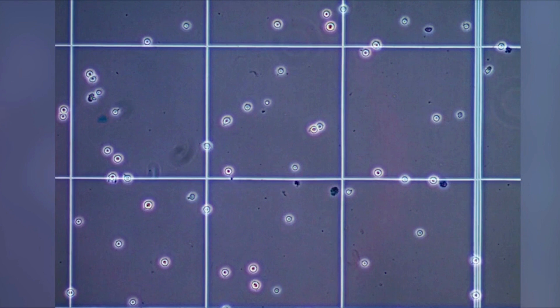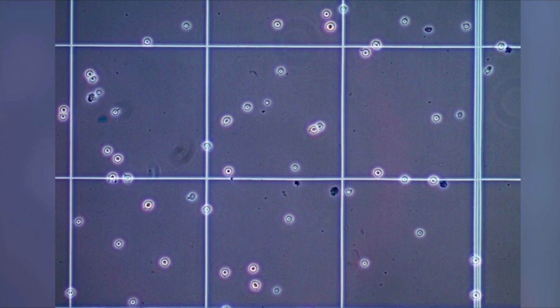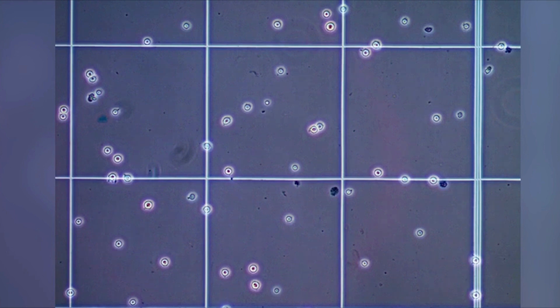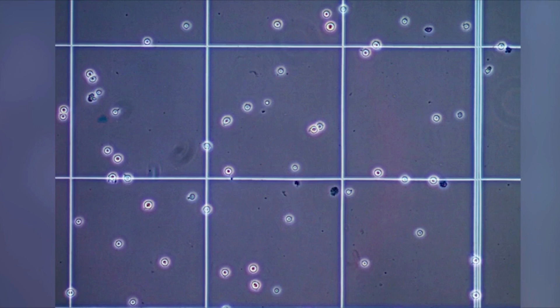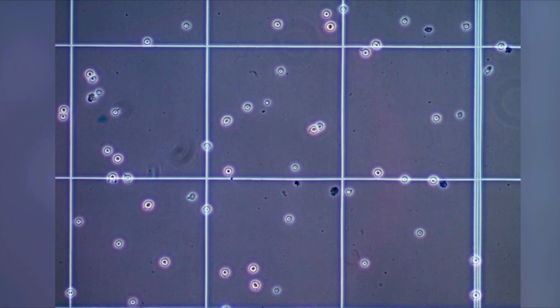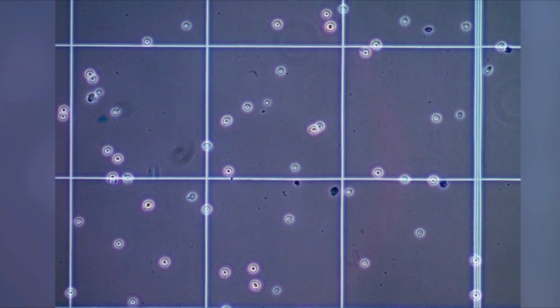In addition to Trypan Blue, you can also use stains such as Erythrosin B or Nigrosin to count cells. Finally, calculate the total number of cells and the viability percentage. Thank you.